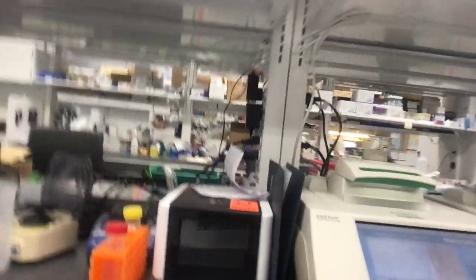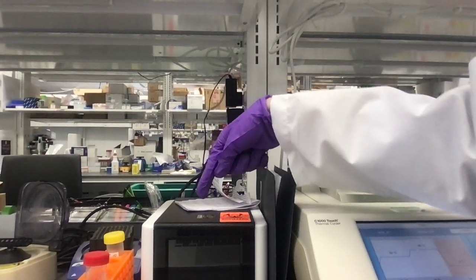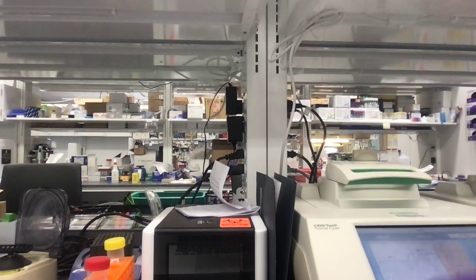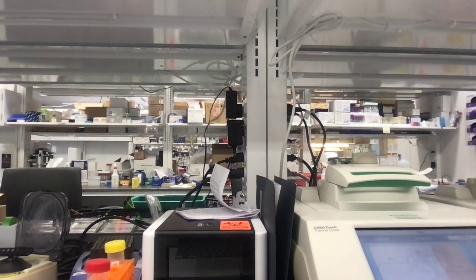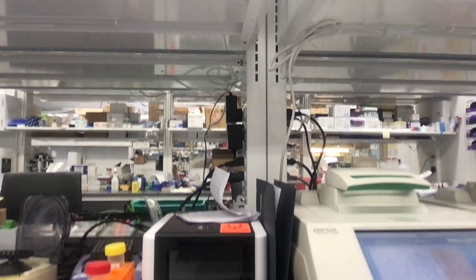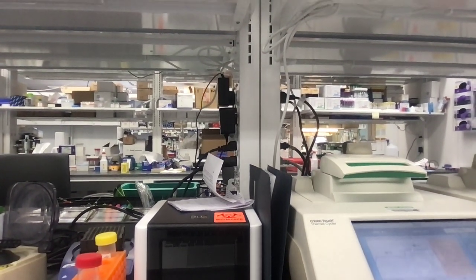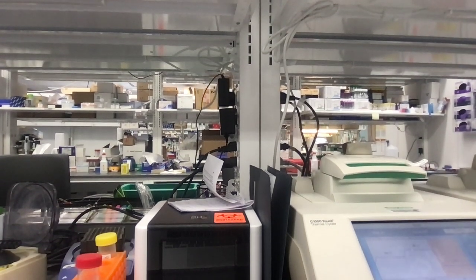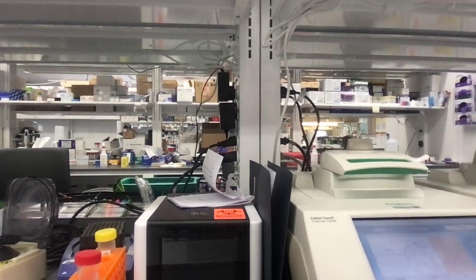We can also see a bunch of equipment here. This black machine is used for single cell RNA sequencing. What it does is add a unique DNA barcode to a single cell at a time, literally a single cell. Then when you use a different machine to sequence that cell, all of its transcripts, all of its RNA, will have been tagged with that unique DNA barcode. So you can know exactly which genes are being expressed in a cell and at which levels. That's really relevant to my research because that's basically what I look at.